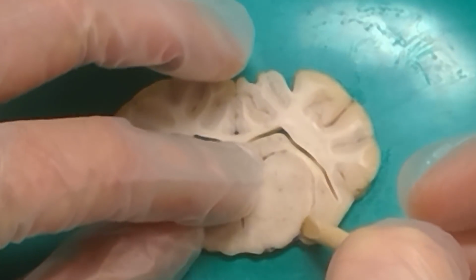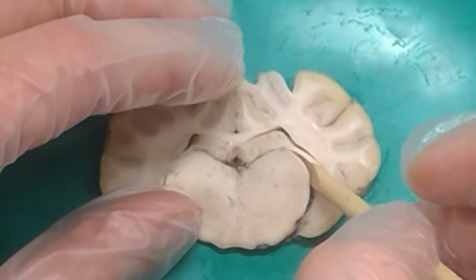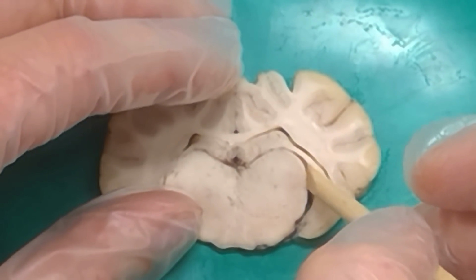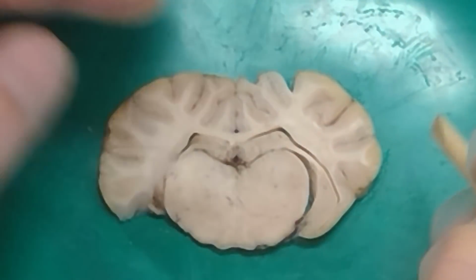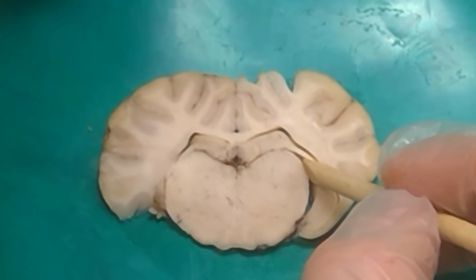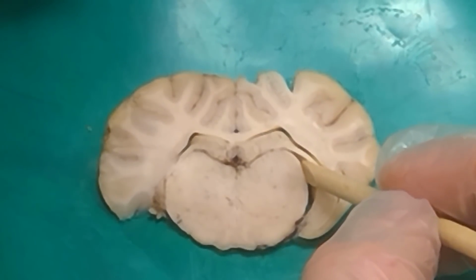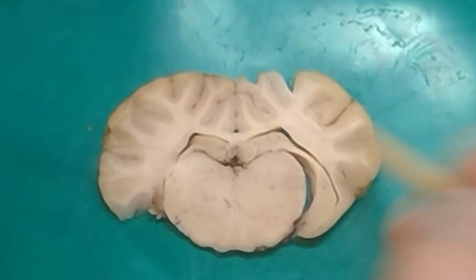On this one, if we pull the hippocampus back, we can see the optic fibers running along right here. There's white along there. And this is the fimbria right here. It'd be kind of fun to stick a pin right between the two and ask, name the fibers just medial to this pin and name the fibers just lateral to this pin. There would be optic fibers on one side and fimbria on the other.